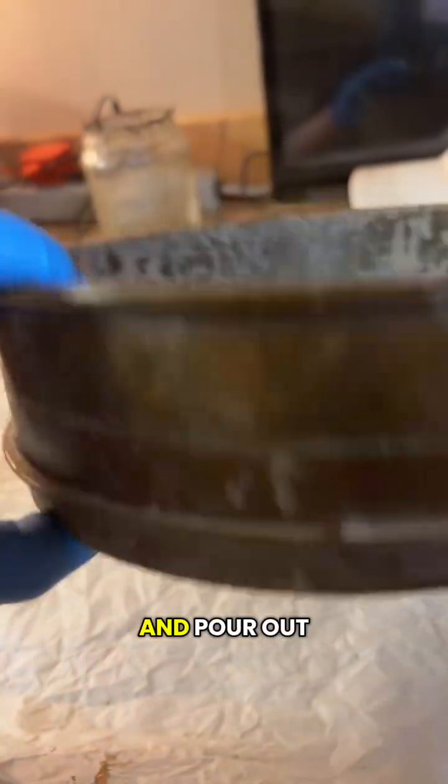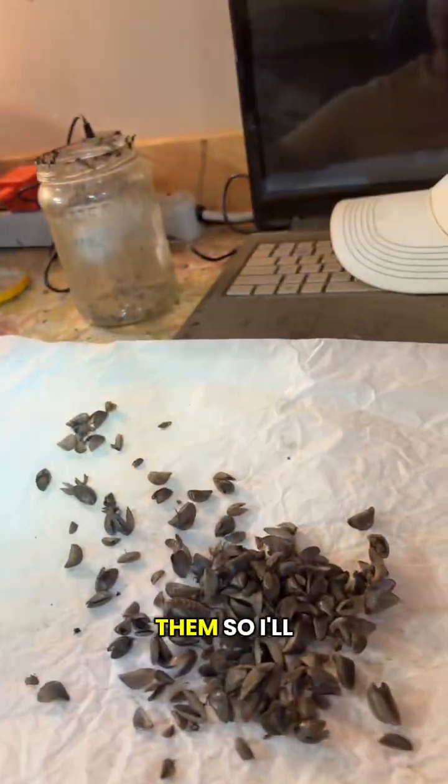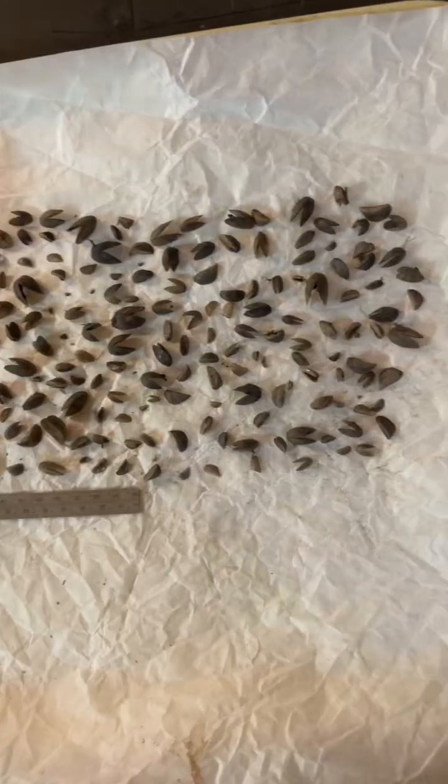So now we just go ahead and pour out our 200-ish zebra mussels, and then I will arrange them to take a picture of them. So I'll show you that in just a sec.